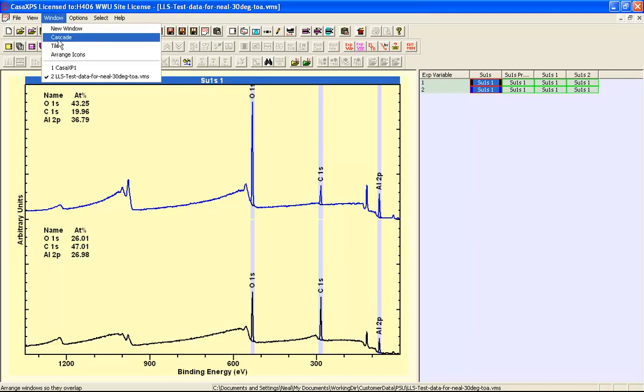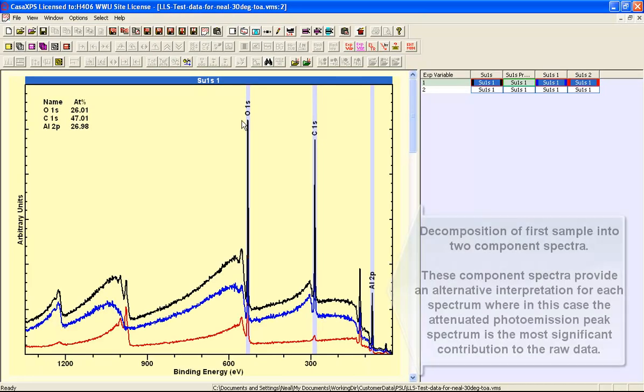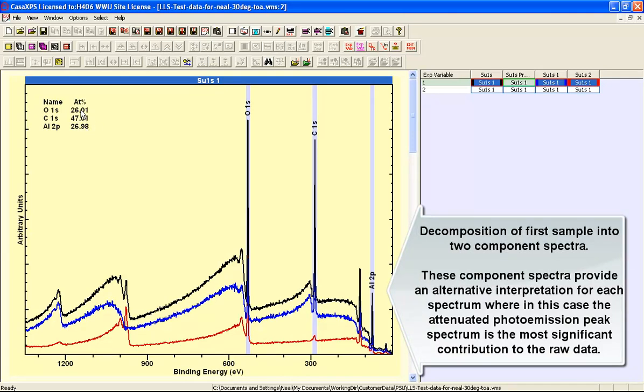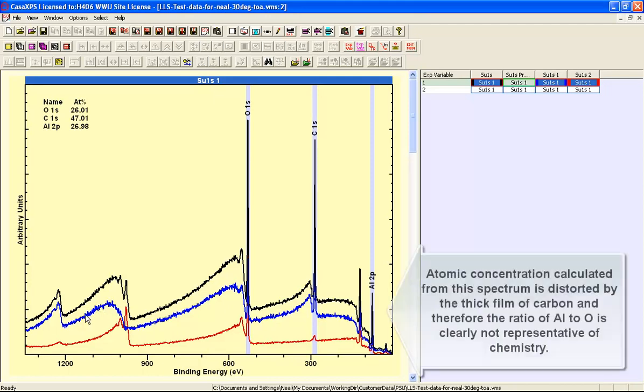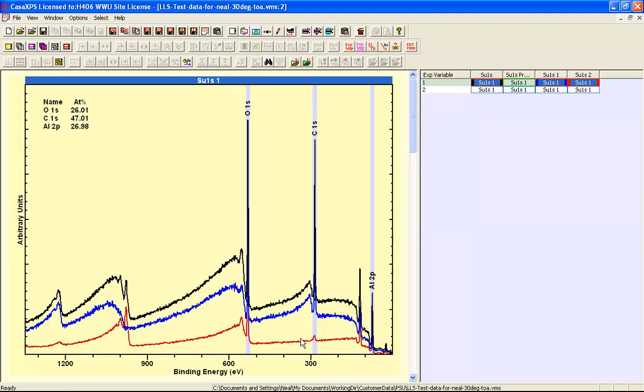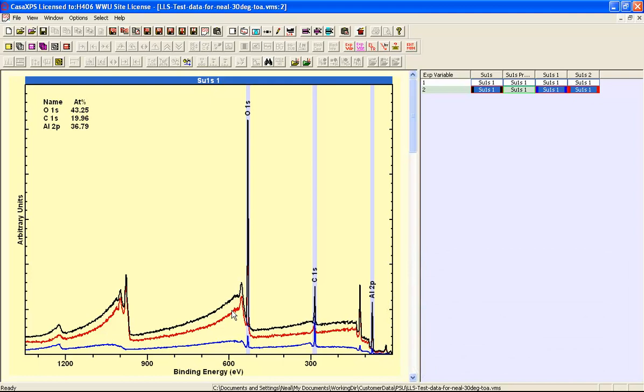And if I now display these in a different experiment frame, an overlay, we can now see that where we have an equal amount of oxygen and aluminium, the spectrum that we interpret as deriving from a thick film of carbon on top of the aluminium oxide is predominant, while the spectrum from a thin film is a smaller component to produce this overall spectrum. Now if I step down, you can see this is the example where we have more oxygen than aluminium, and in this case this situation is reversed, that the thin film spectrum has a dominant contribution to the spectrum, and there is a spectrum from a thick film overlayer.